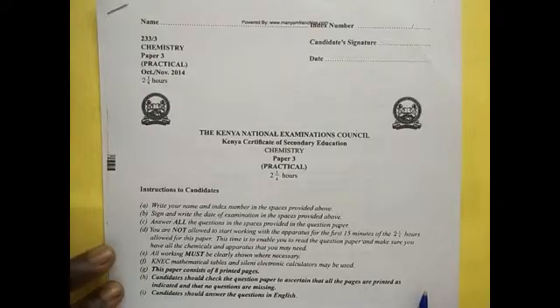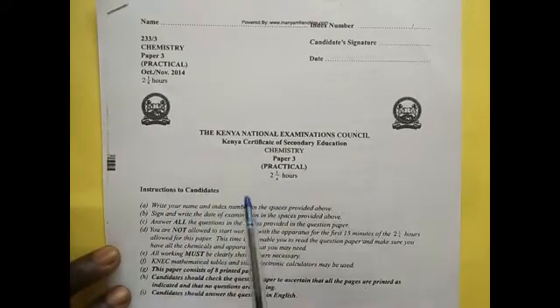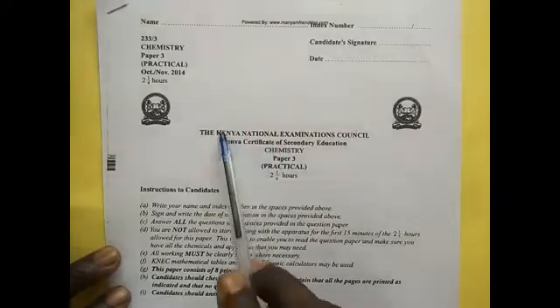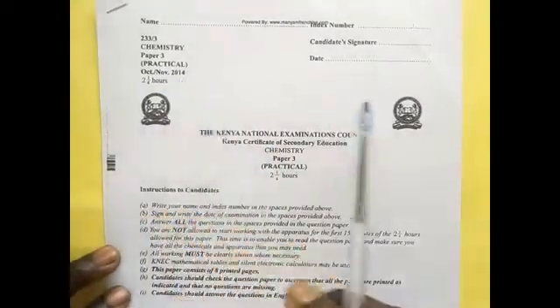Allow me to take you through KCSE practical paper 3, Chemistry paper 3, the year 2014.